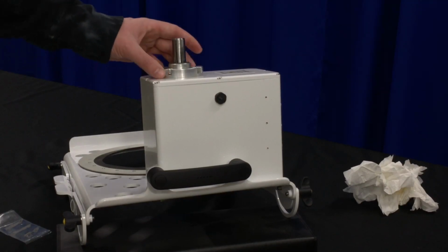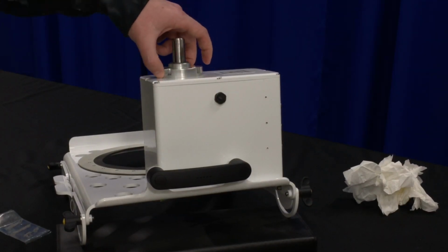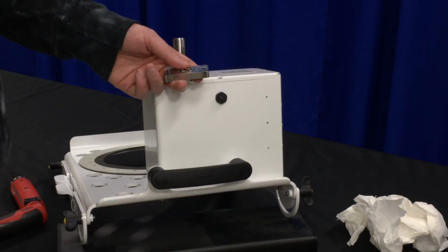When that's done, make sure there's no gap around the shaft seal assembly. If there is, it could mean that the O-ring in the bottom is misplaced and won't seal properly.